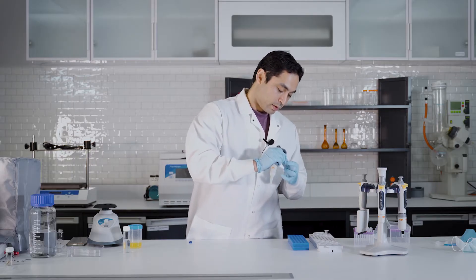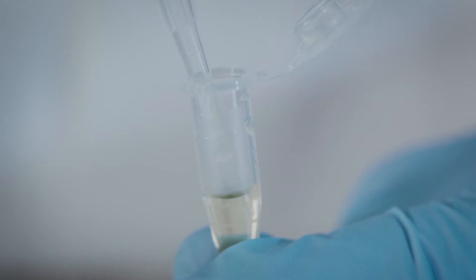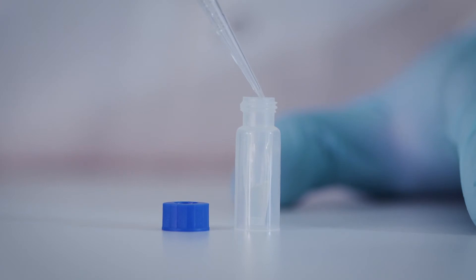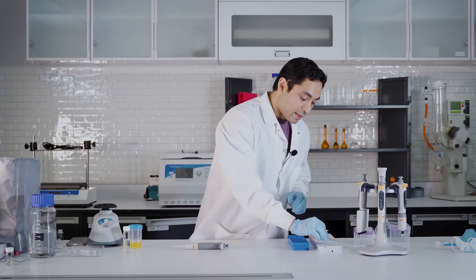Take my sample. Just take out the supernatant. Make sure not to disturb the pellet on the bottom. And this goes straight in the vial. And that's ready to go in the HPLC.